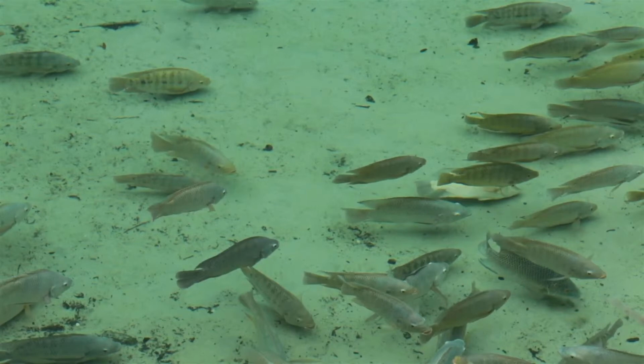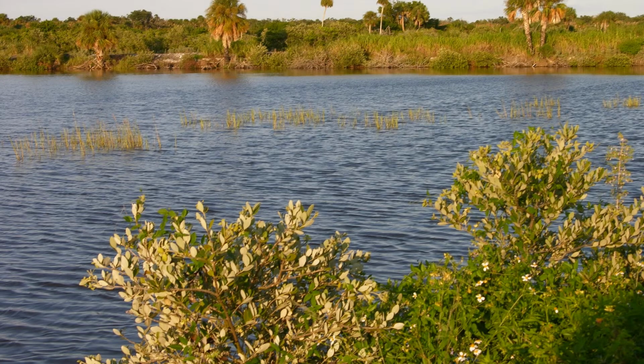Warm water fish need a minimum of 5 milligrams per liter dissolved oxygen. Most fish become stressed when dissolved oxygen levels drop below 4 milligrams per liter and fish begin to die below 2 milligrams per liter. Using our Winkler method results, you can indicate if the water has enough oxygen to support fish life.